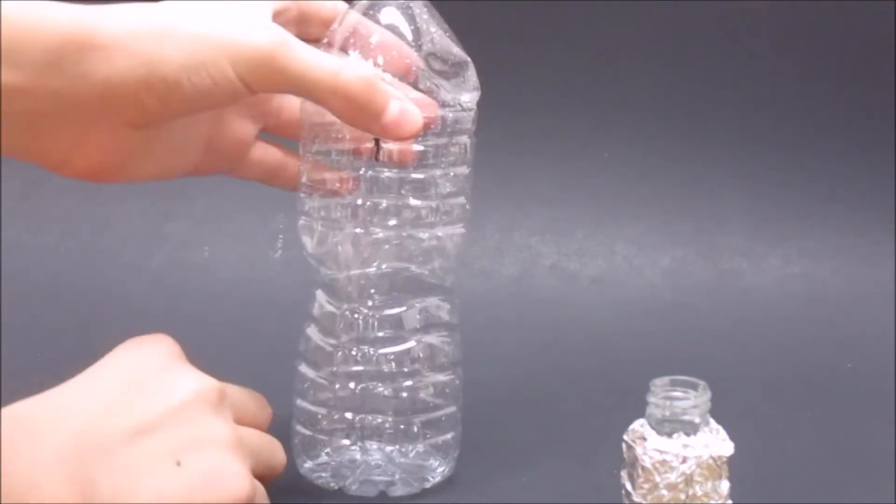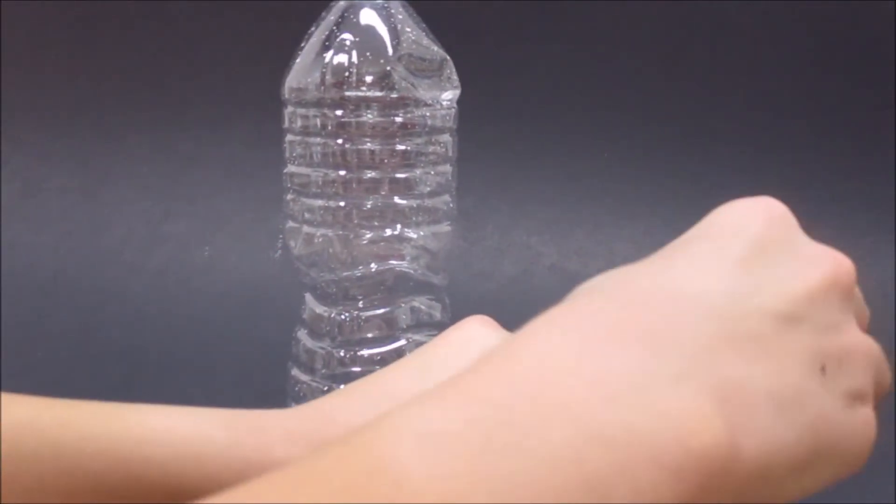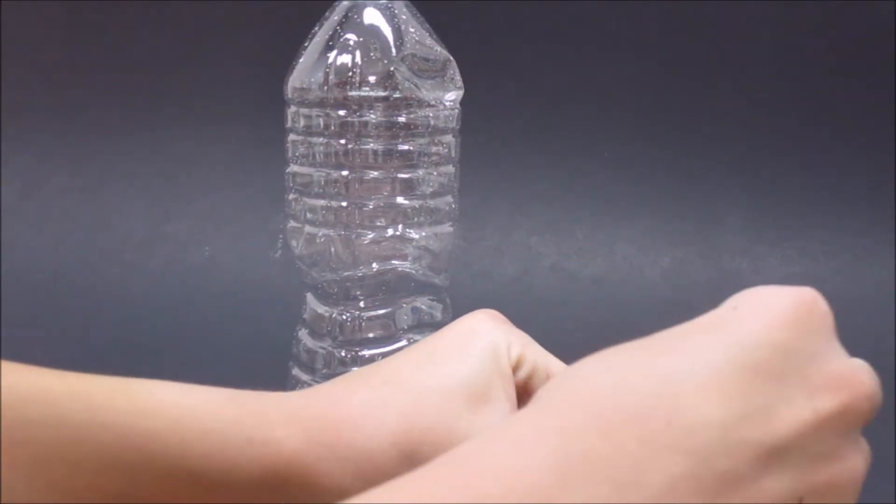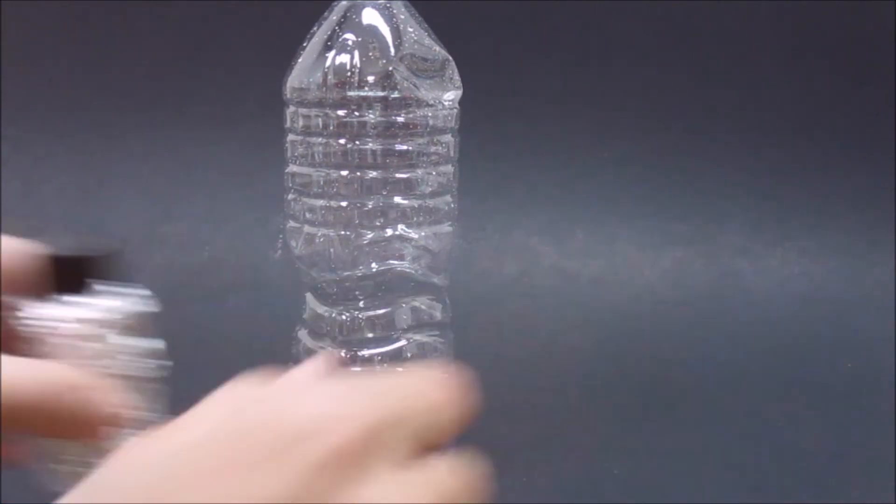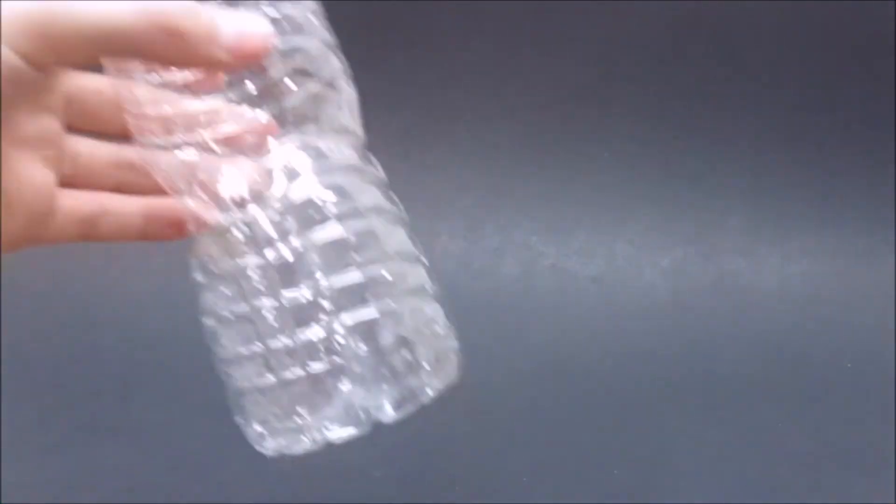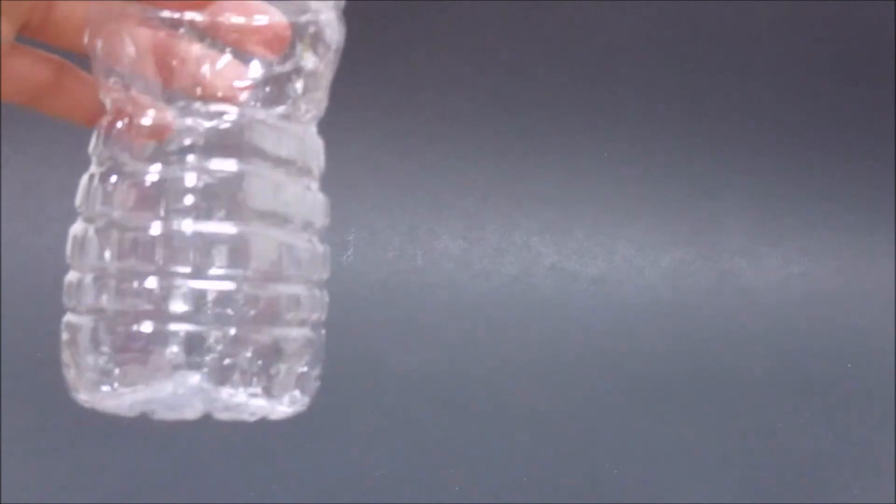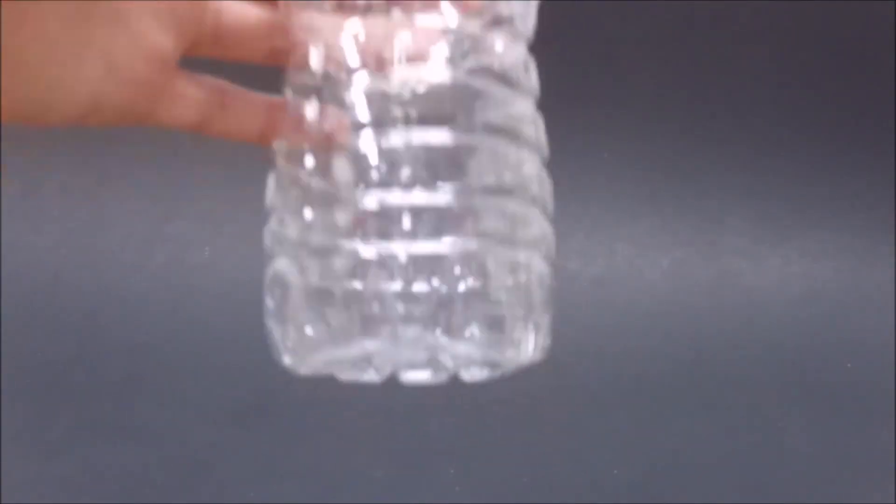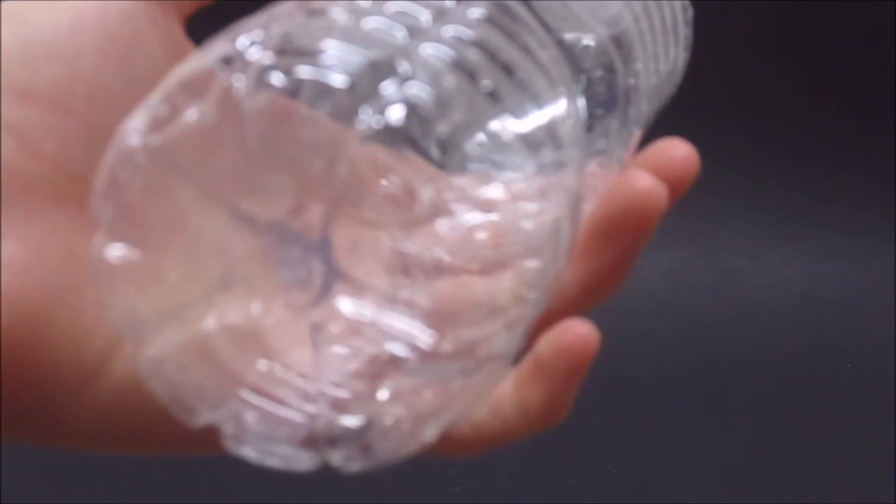I shook the bottle a little bit to turn the chloroform liquid into chloroform vapors, and then I shook it a little bit more. When I saw the bug again, the chloroform already seemed to be taking its effect.